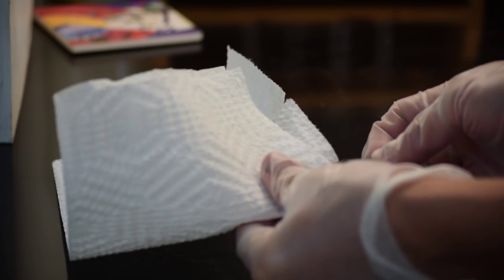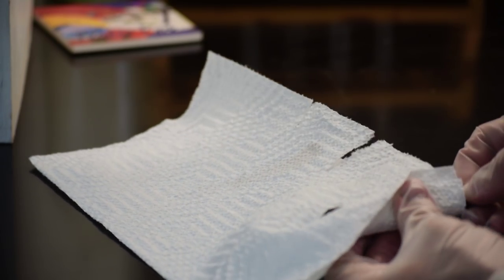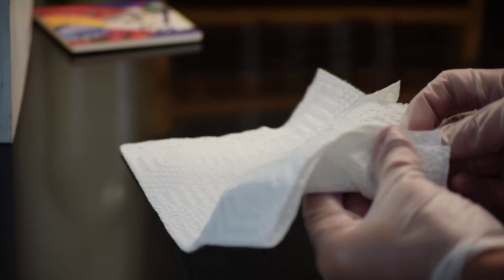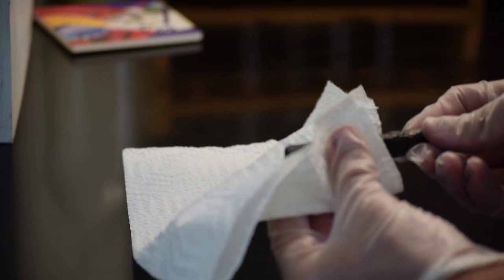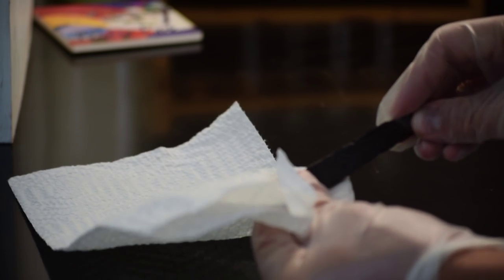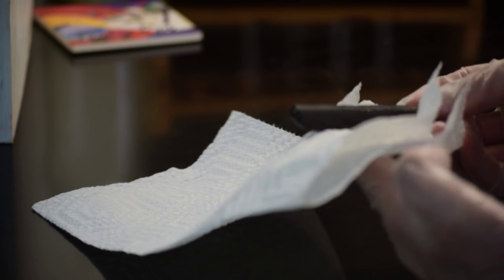You need to make sure that you're wearing gloves while you're doing this because you're working with not only toxic lead compounds, but corrosive sulfuric acid. And I haven't said this earlier, so I'm going to say it now. This is very dangerous to work with lead this closely, and when you're done, you need to make sure you thoroughly wash all your glassware and your hands.